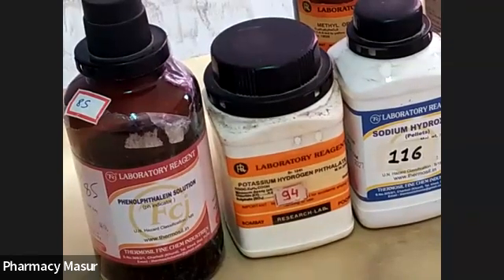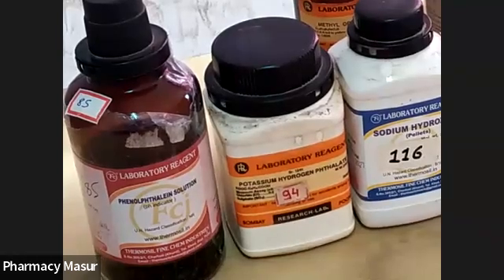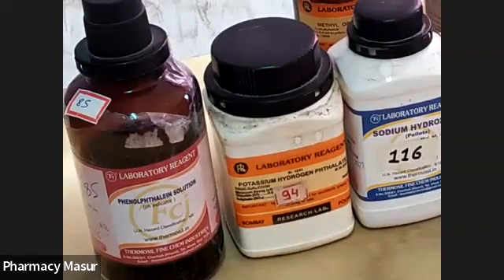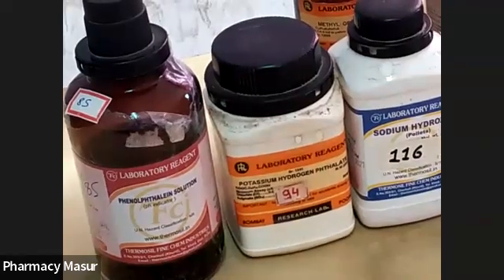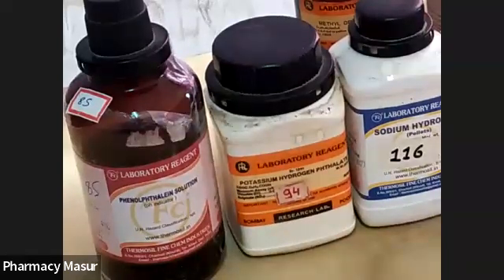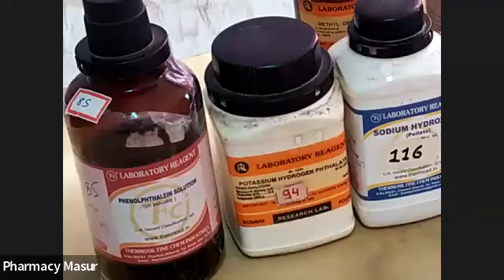We have to prepare a solution of 0.1 normal NaOH and 0.1 normal KHP. The calculations for this are given on the board.